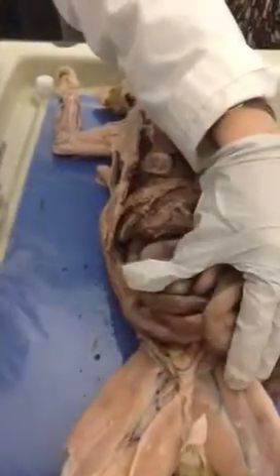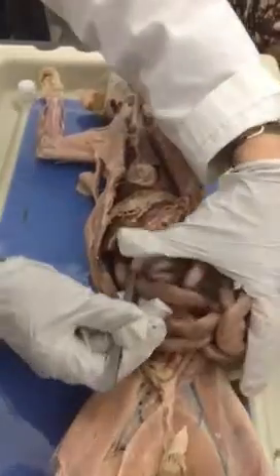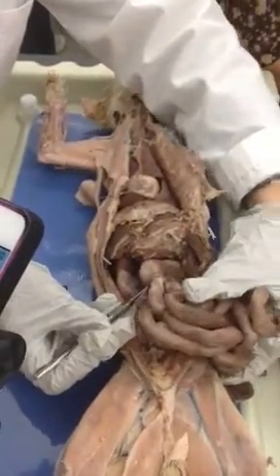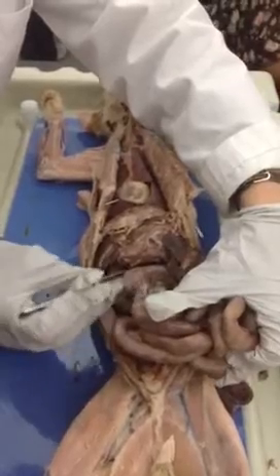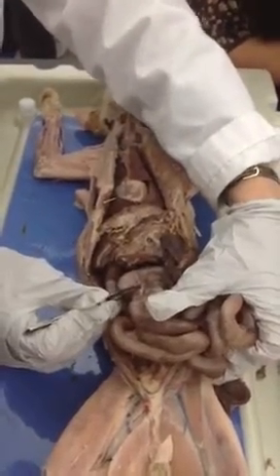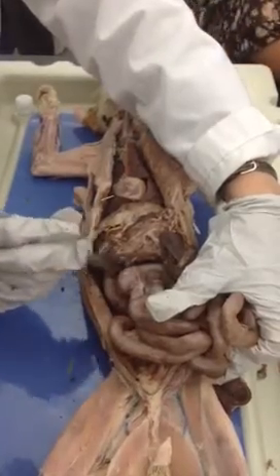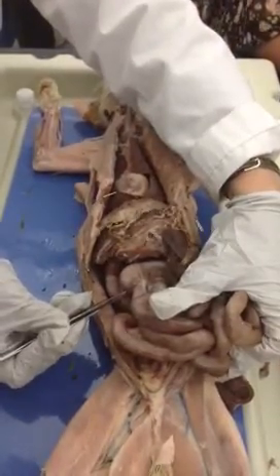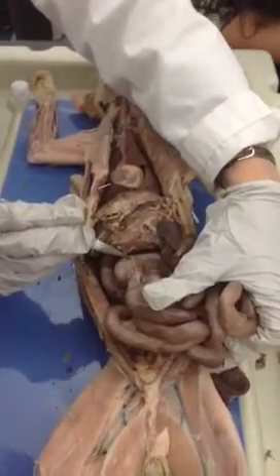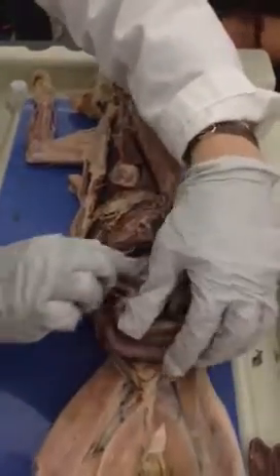Okay, on the large intestine, if the pin is stuck in the very tip here, that's the cecum. The connection between the ileum and the cecum section, if it's between that, then that's the ileocecal valve. If the pin is kind of in this area but not at the tip and doesn't have a card that says curve, that's the ascending colon. And on yours, we'll kind of twist it a little bit here.